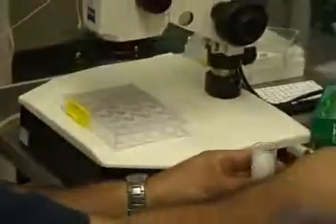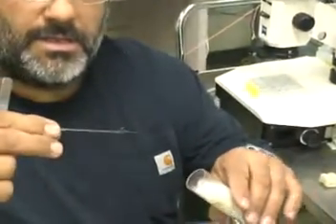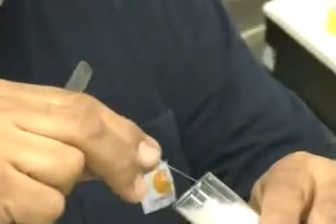To remove the water from the inside, you need to have a smaller capillary — this is 0.1 — and it's a lot smaller. We use it as a syringe to remove the water.